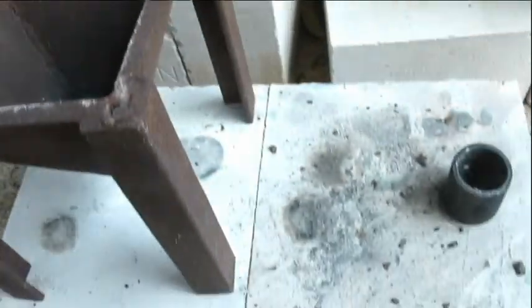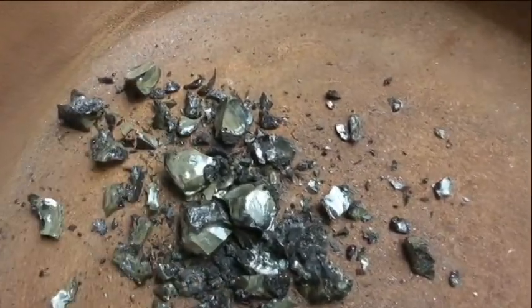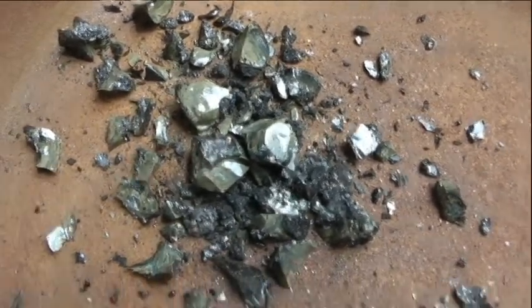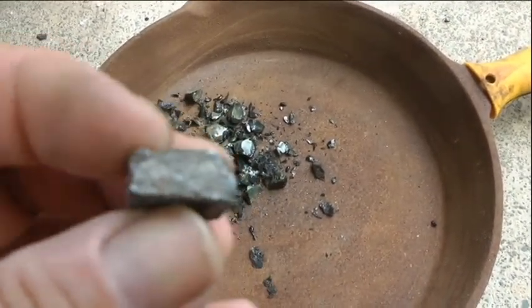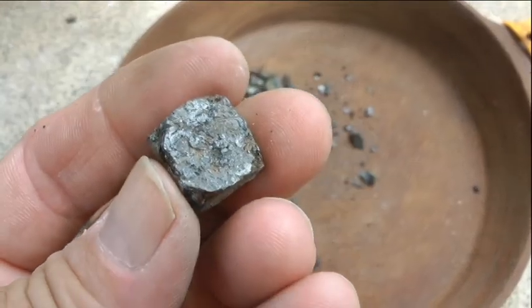Right, got that one out of there. Gonna have to show it. That's what came out. Got this sort of greeny look about it. Don't know what that's all to do with. The last one was like that. And there's the block of lead. I've already flattened it. Got to cupel that out and see if there's anything in it. Alright.